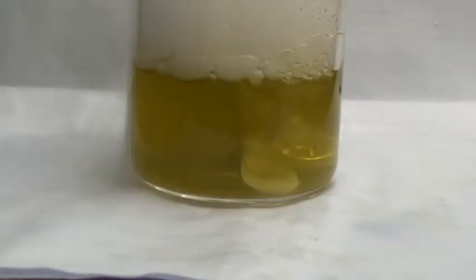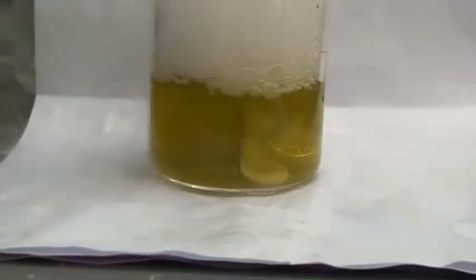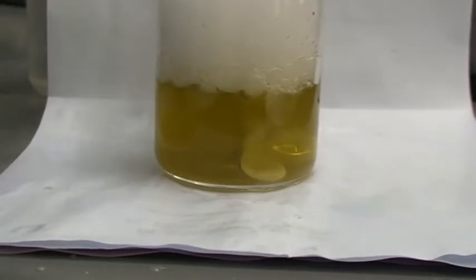There's no more precipitate because now you have carbonic acid plus calcium hydrogen carbonate. So with dry ice, you can actually perform quite a lot of experiments, apart from converting it to liquid carbon dioxide.